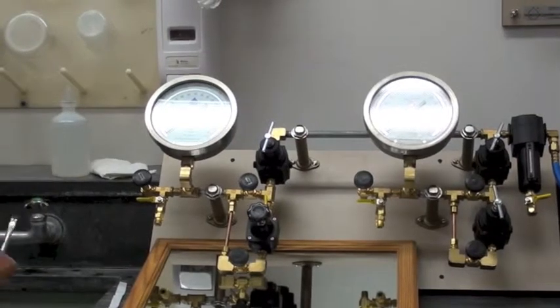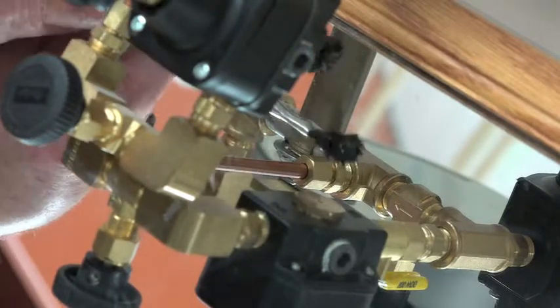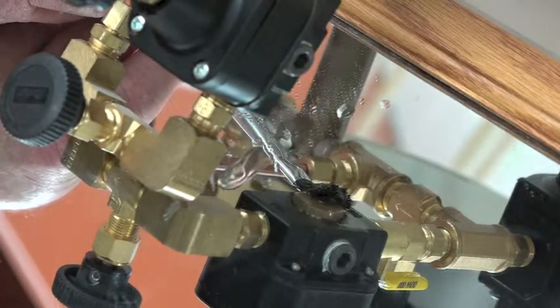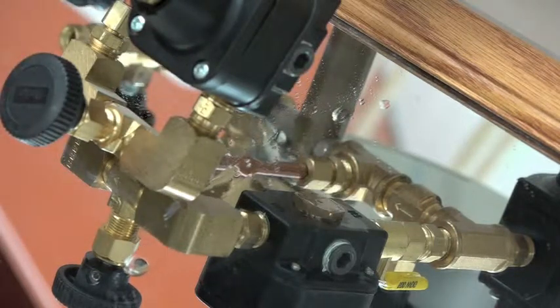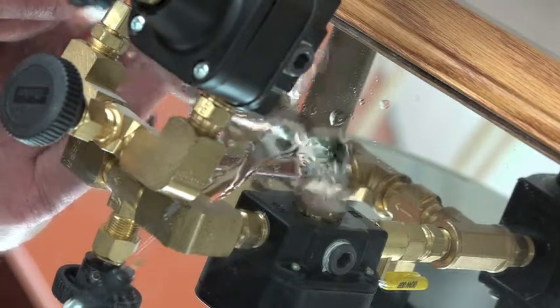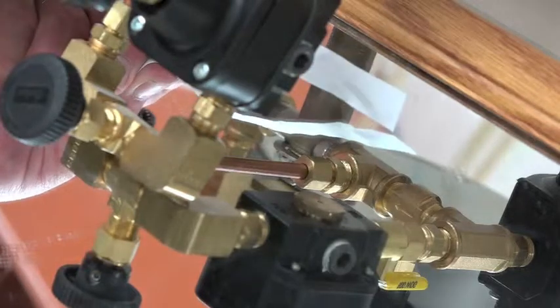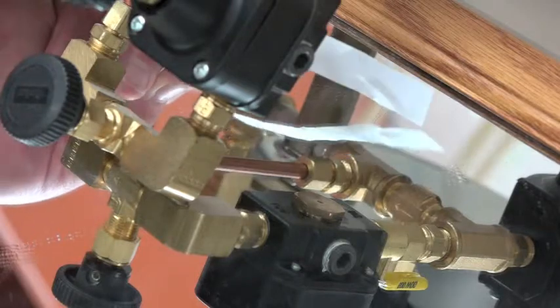soapy water here. We go to the back and we observe we're getting bubbles. So this is the normal air leakage on the back of the Nullmatic. Completely normal. You can see it bubbling there. Perfectly normal bubbling. If we were to put a piece of paper behind here, we hear no noise and we don't see any movement of paper that's put behind there.